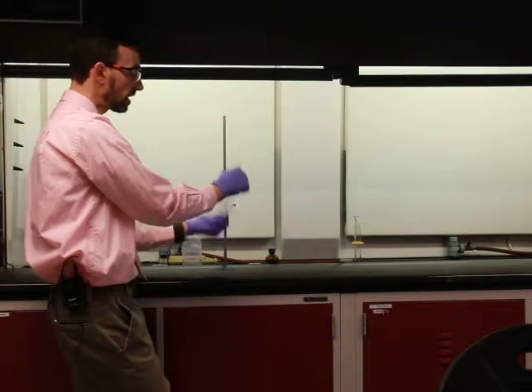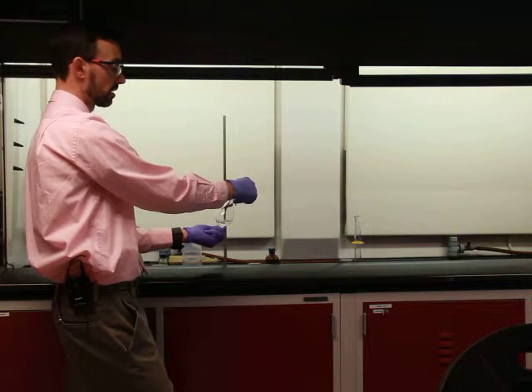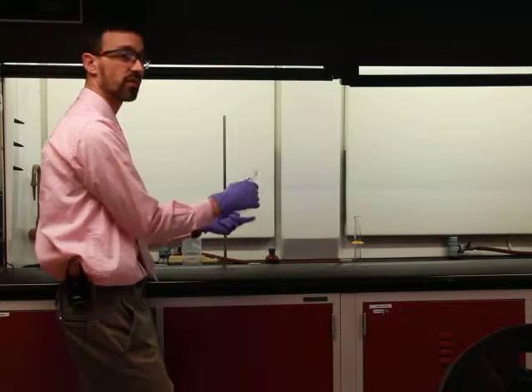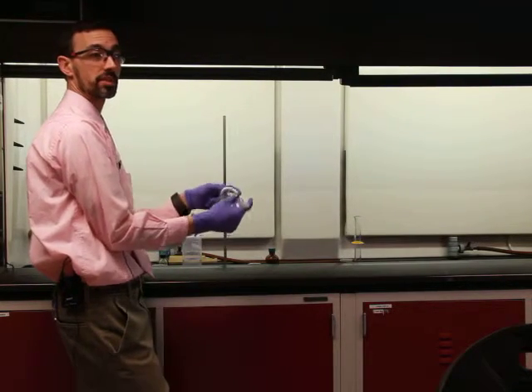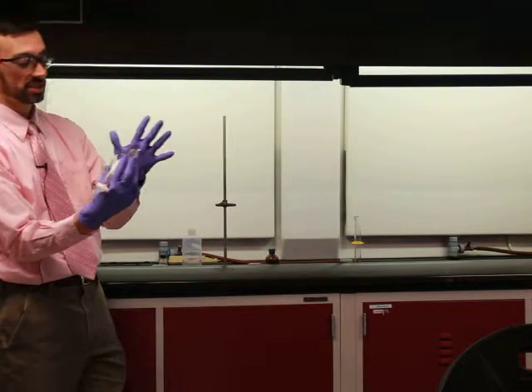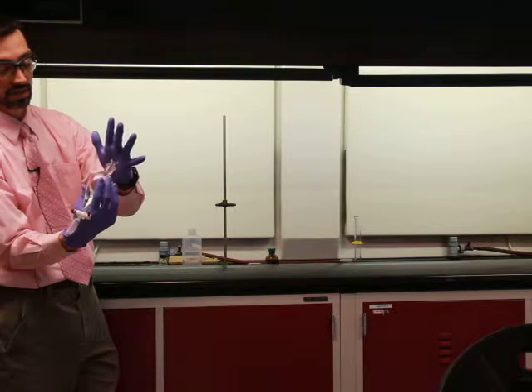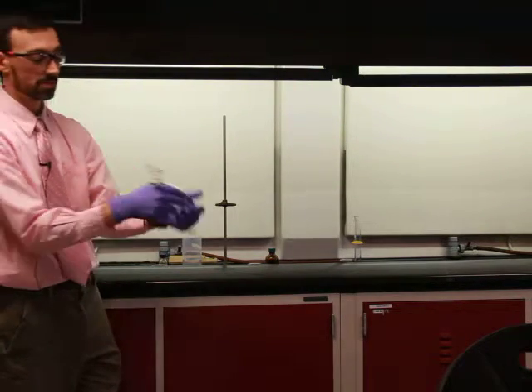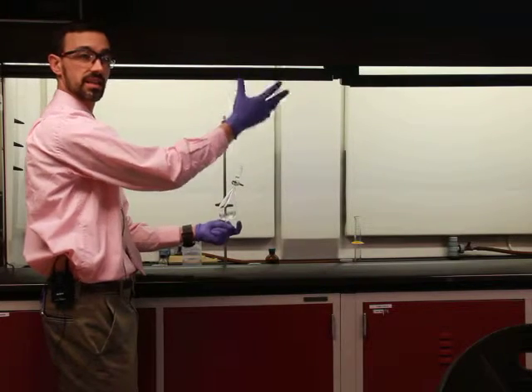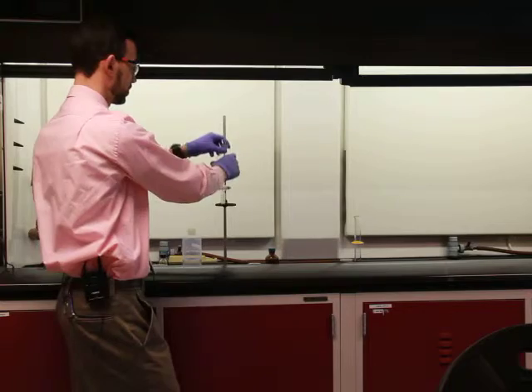When we have a volatile solvent like ether, right now it's generating pressure. Okay, and so it's not generating a whole lot of pressure. But we want to be very careful to vent any pressure that builds up. So it's very commonplace to hold this upside down. I'm pressing the glass stopper against my hand, and then you could just open the stopcock to vent it and let that pressure that builds up out. Okay, and that pressure varies from one to another.